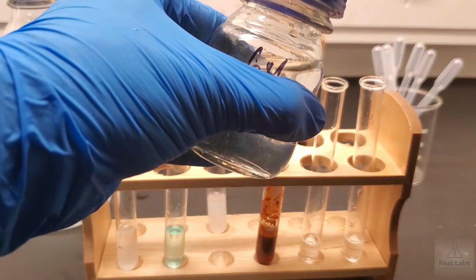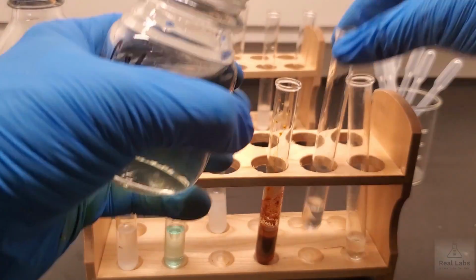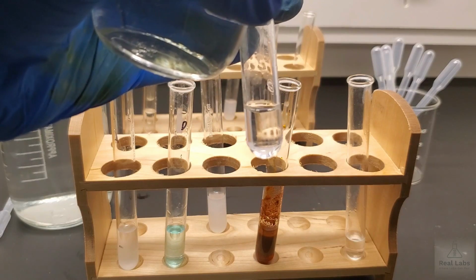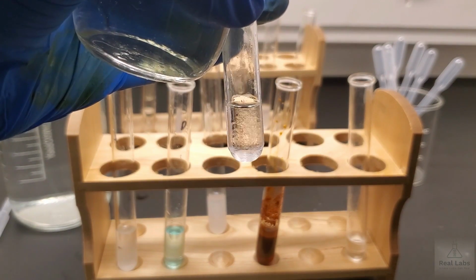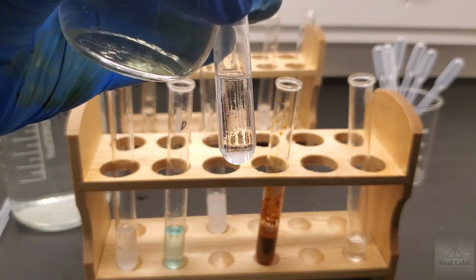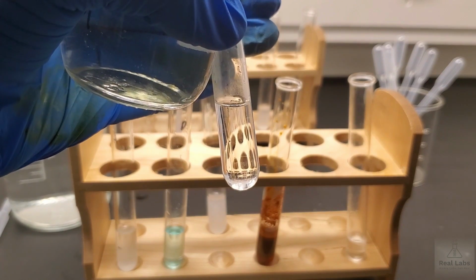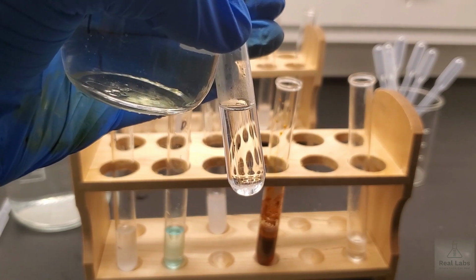So this is reaction number 4 that you ran. This is sodium hydroxide with hydrochloric acid. So I'm going to run exactly the same system. We've just got the fresh sodium hydroxide, and we'll see what happens this time. So you see the mixing is pretty clear, but this time we don't see that cloudiness that we saw the first time. So it looks like my supposition was right. The sodium hydroxide might have been contaminated with something that was giving us precipitate that it shouldn't have done.